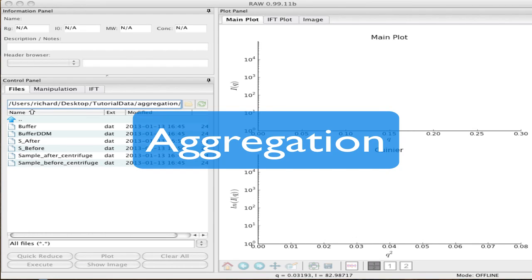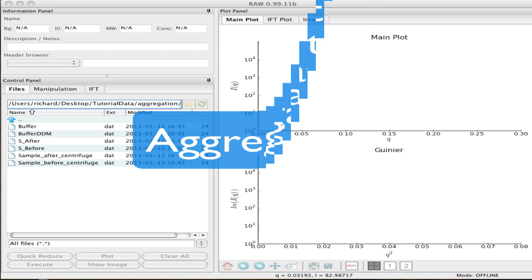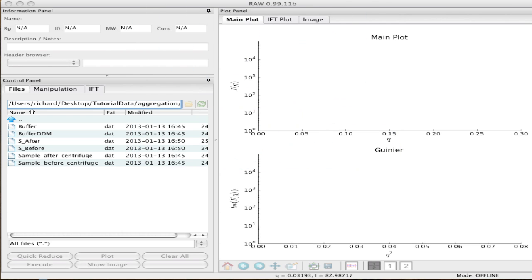Welcome back to RAW. In this demonstration, I'm going to show you what aggregation looks like. Aggregation is the single most widely experienced problem in SAXS. This particular example is unique in that it just so happens that a very aggressive centrifuging of the sample will rescue it from aggregation. So you can see what the sample looks like before and after.